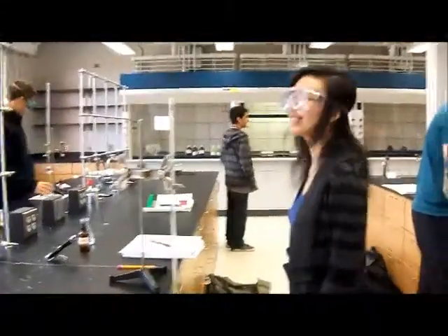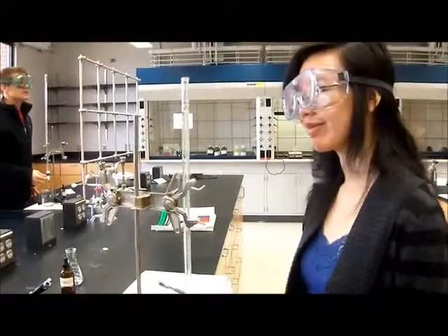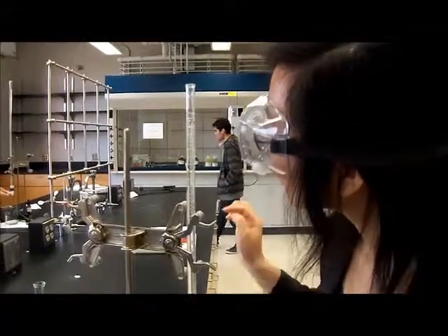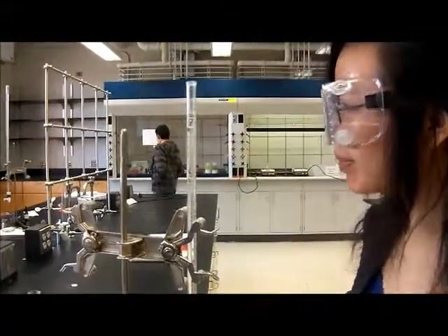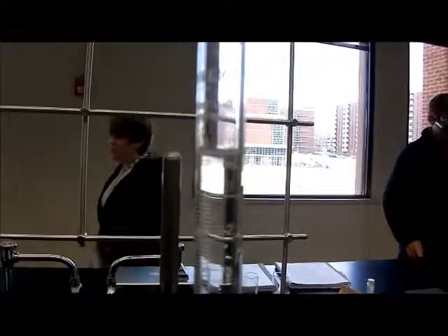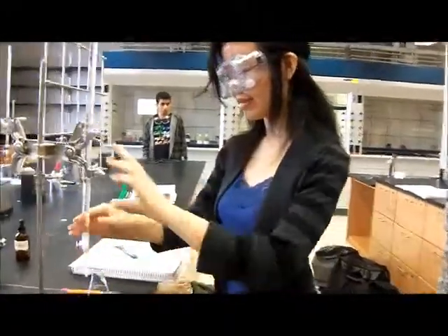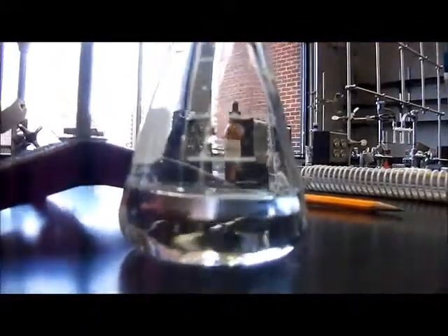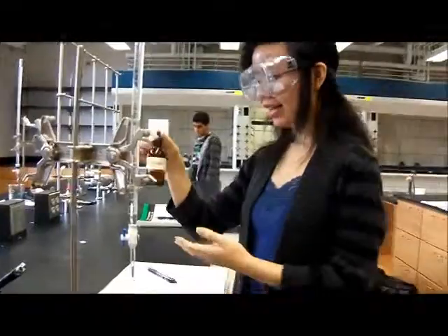Whitney is going to do our second titration. She's going to look at the initial volume, and she's looking at the meniscus. Okay. I'm going to take a picture of the meniscus. Okay, so it's very close to the 0. So we're going to see you record it in your lab notebook. And the initial volume of our analyte is 50 milliliters. Whitney's adding her phenolphthalein.